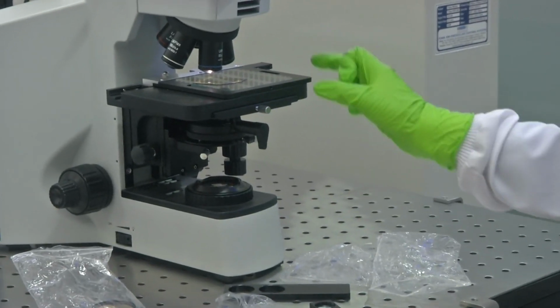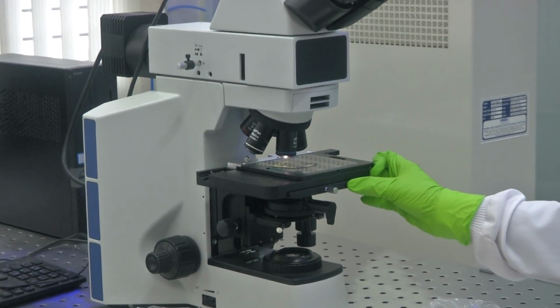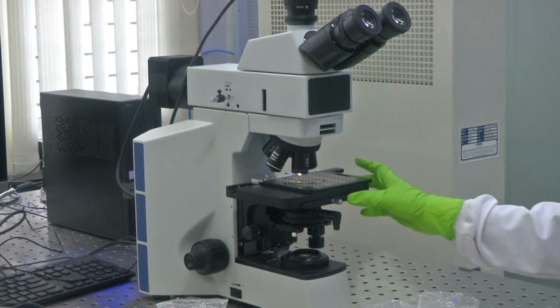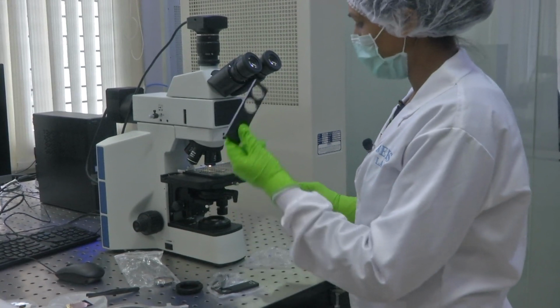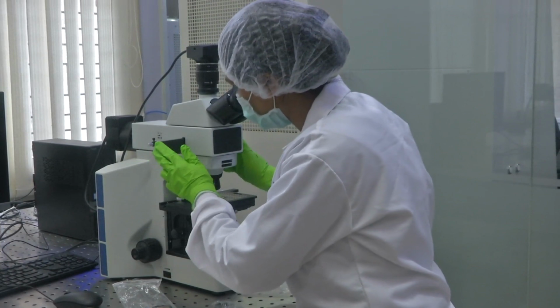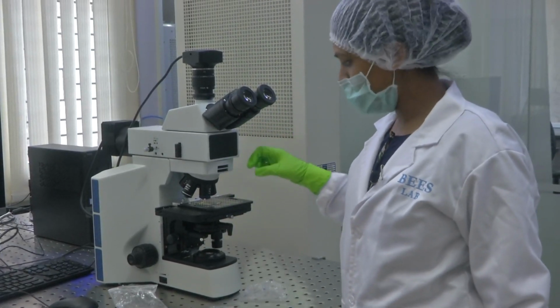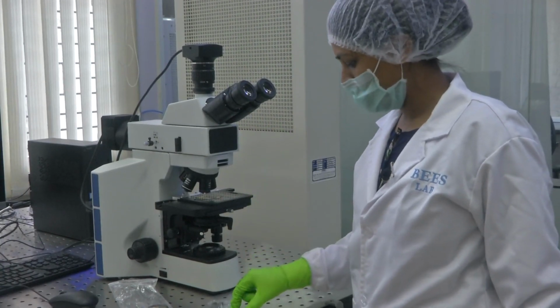Now, let us see how a silicon wafer can be placed on your sample holder, the stage what we set up, and let us see how we could focus it and then view it on our system. Now that we have seen how the different filters can be used, let me put back this slot. So, it goes in here, and then you could use this utility in order to control your aperture, that is the amount, the focus area, and you could also use it for filtration, filter the light.